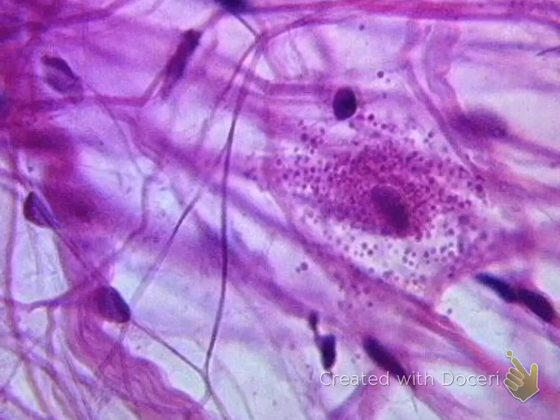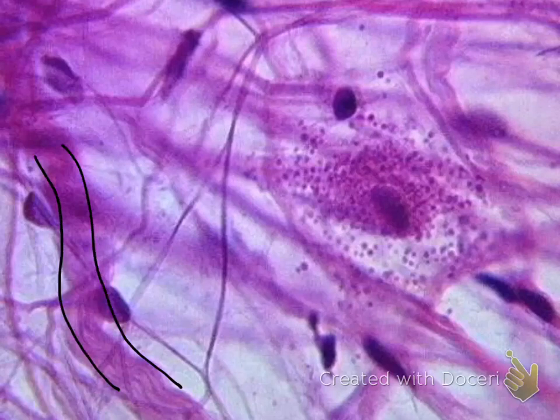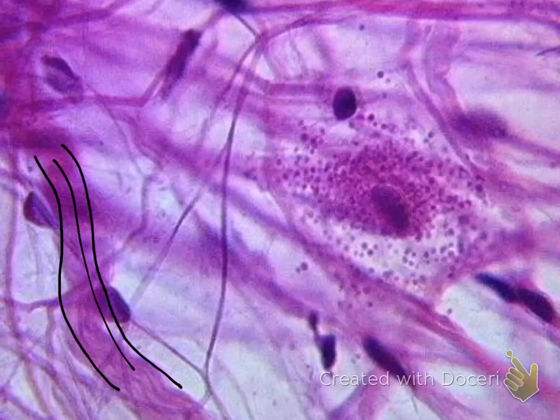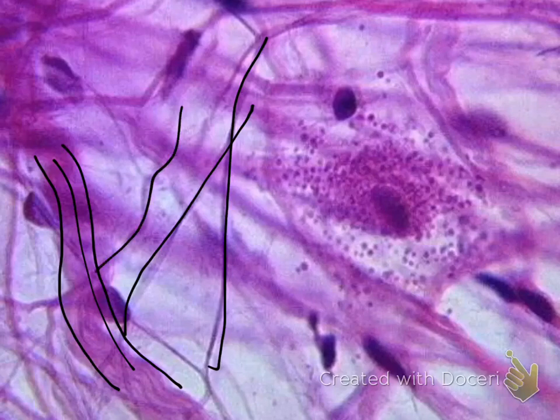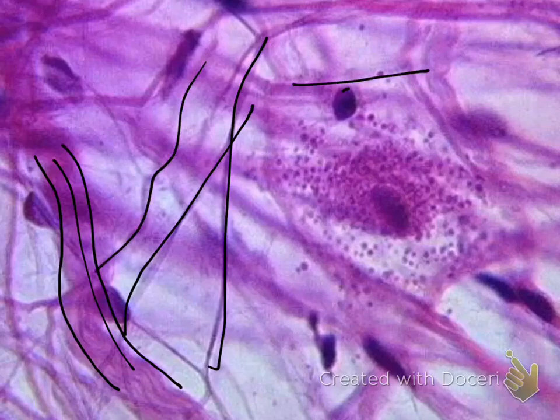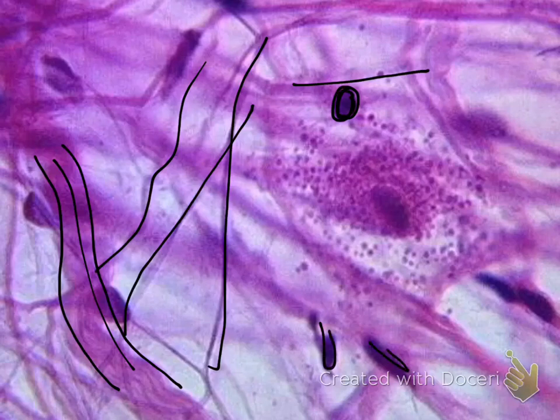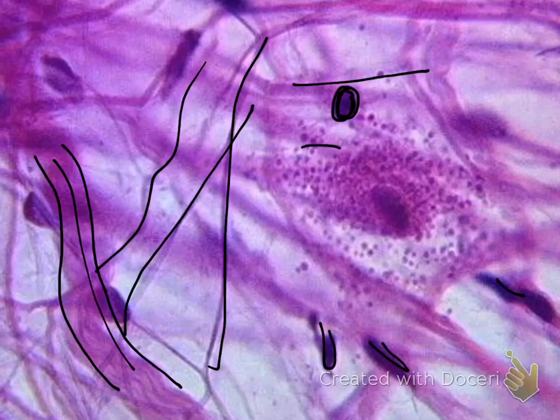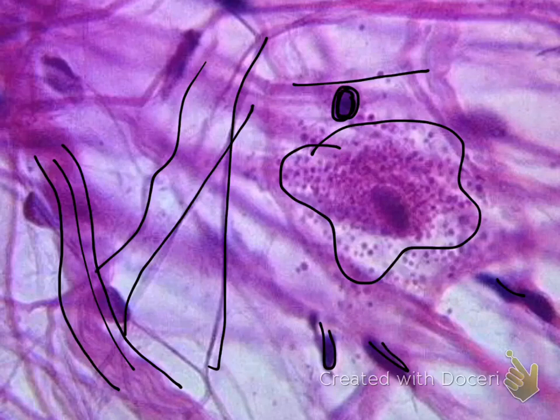Here is another tissue with collagen fibers running in one direction and elastic fibers running in a crisscross direction. You notice these cells are your fibroblasts, and this granulated cell is your mast cell. Looking at all of those materials inside the tissue, you know this is areolar connective tissue.